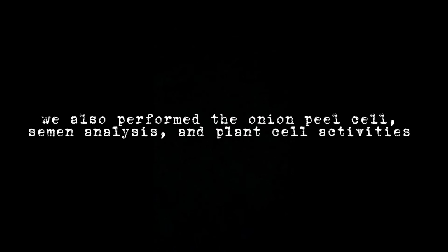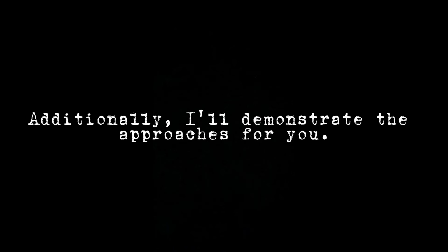In addition to the hay infusion, we also perform the onion peel cell, semen analysis, and plant cell activities. Additionally, I will demonstrate the approaches for you.